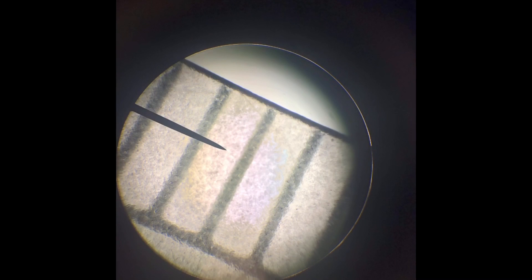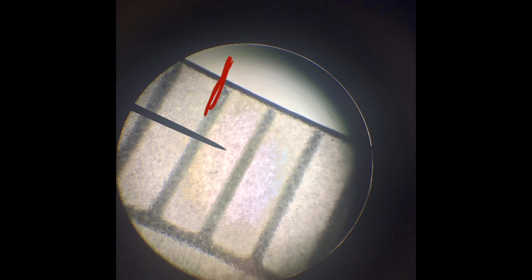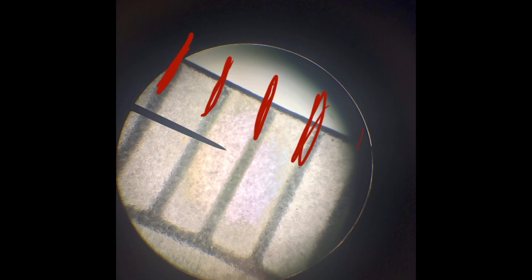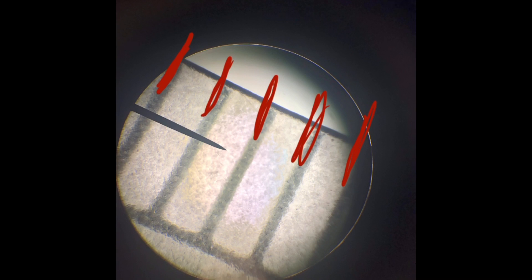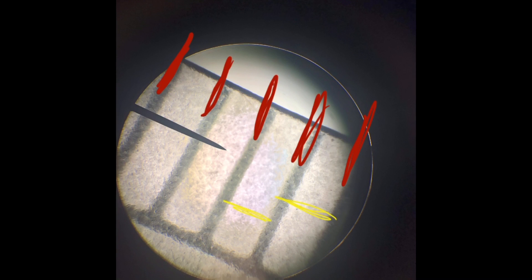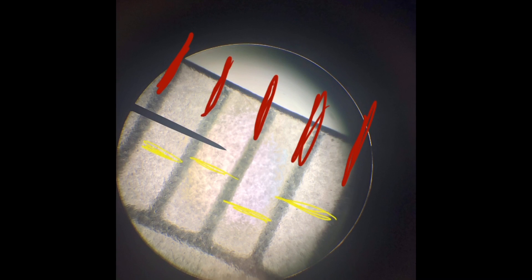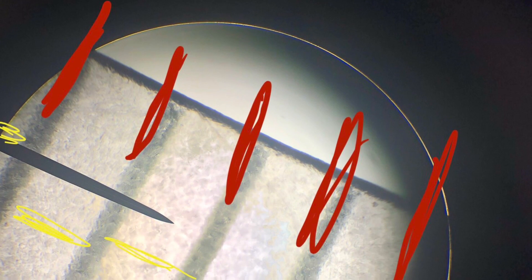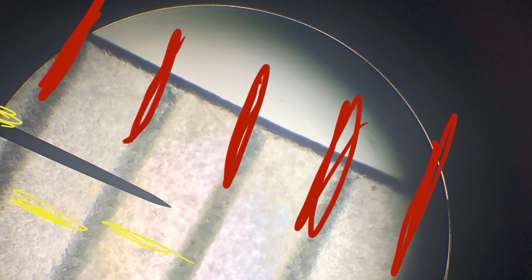Here's a photograph of the field of view and I'm going to mark up each of the millimeter lines. There's one there, there's one there, there's one there — so each of those lines represents one millimeter. If I want to add up how many millimeters are in the total field of view, I just count the distance, the number of millimeters between the lines. On this field of view, I know for sure that there are four millimeters, and I'm going to estimate that there's maybe 0.2 of a millimeter beyond that. So I'm going to call this a measurement of 4.2 millimeters.